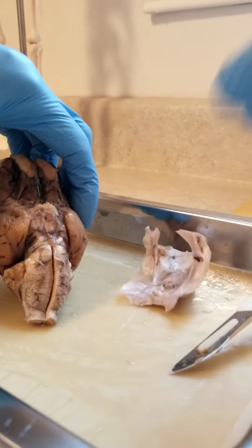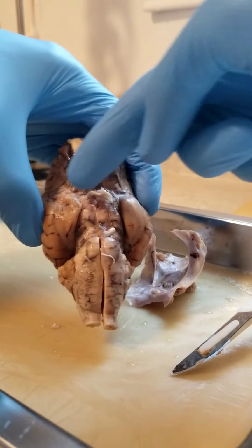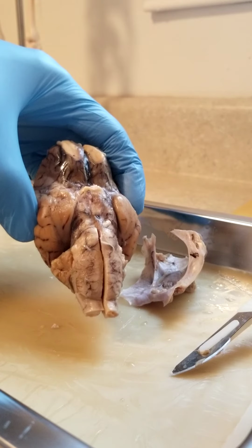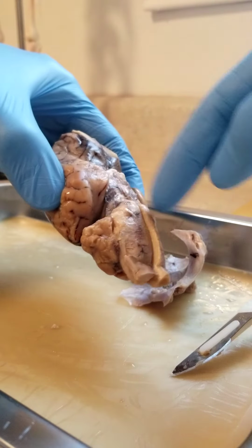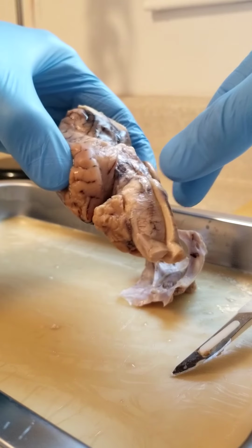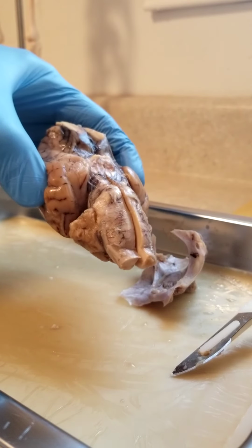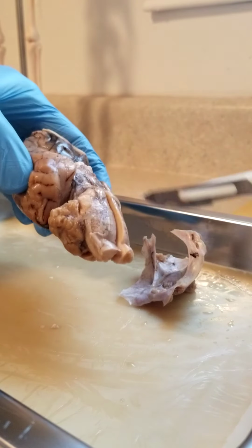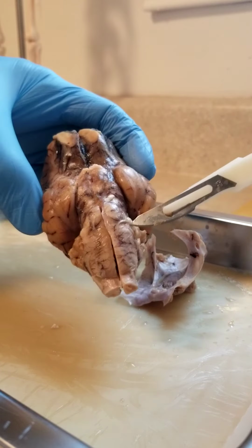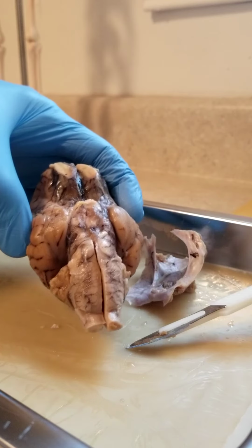All right, continuing on, we have the oculomotor here on the side. And the trochlear, visible, would be right there on the side as well. And the trigeminal and the abducens, looking right here on the side. Kind of just depends on the specimen if you get it or not. And that's going to cover everything on that portion.